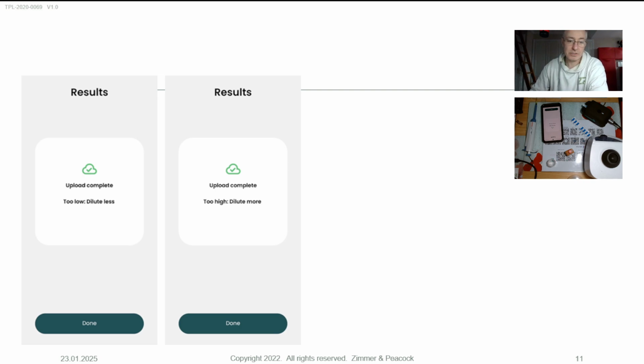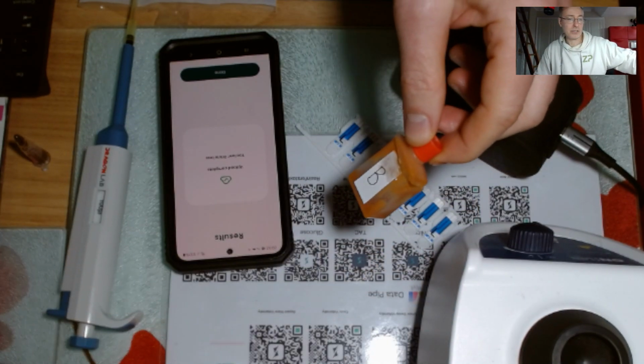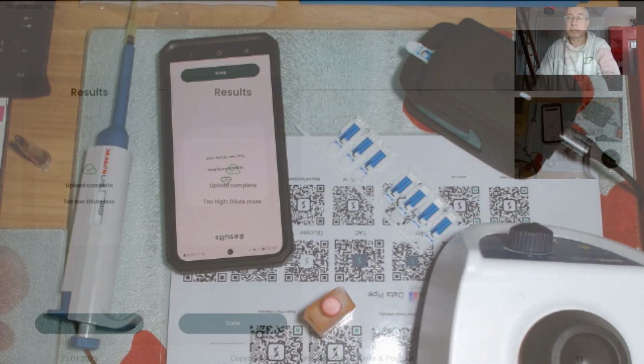I suppose I should just do a segue and say we are talking about the FoodSense Generation 4, in this particular mode, for testing the hotness of chilies. I do have a chili sample here, and I'm going to try and troubleshoot this particular customer's issues using the FoodSense Generation 4, which is in front of me at the moment.